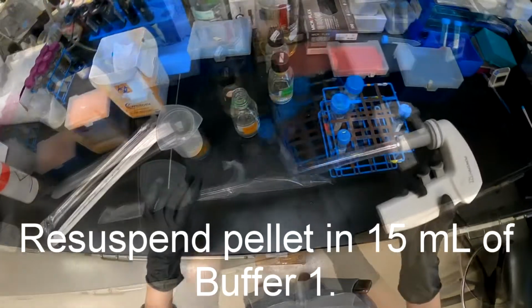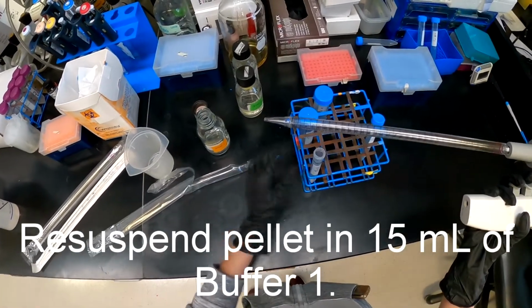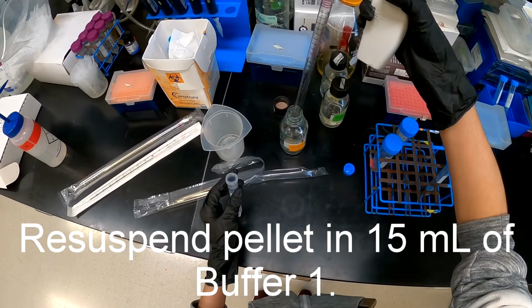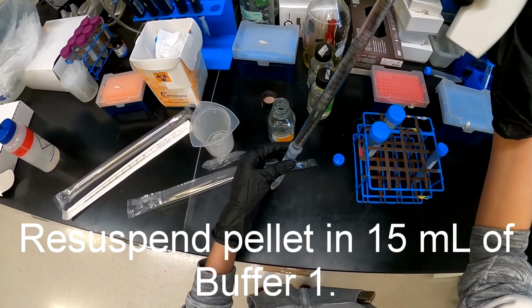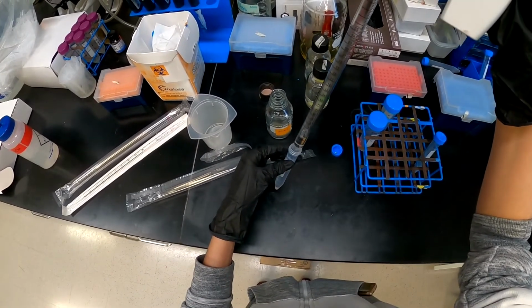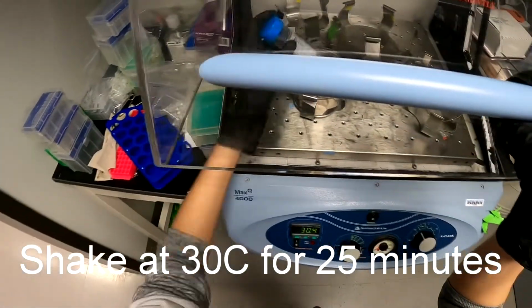The cells were then resuspended in a mixture of Tris-HCl and DTT, otherwise known as dithiothreitol, which reduces protein disulfide bonds, that we will refer to as buffer 1. The cells were allowed to shake at 30 degrees Celsius for 25 minutes.